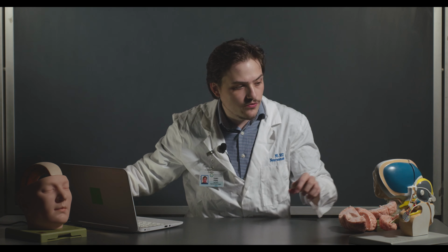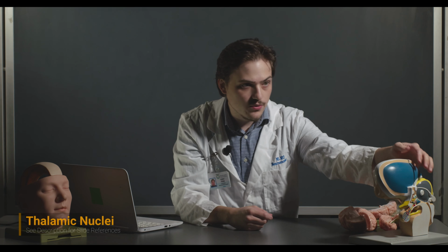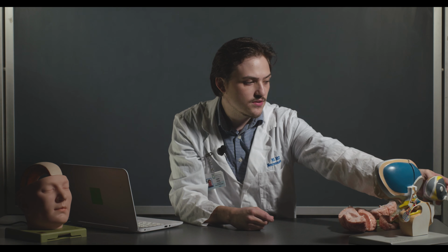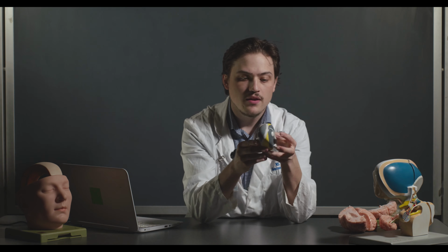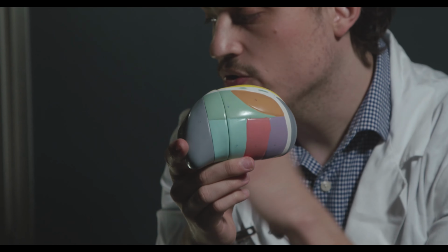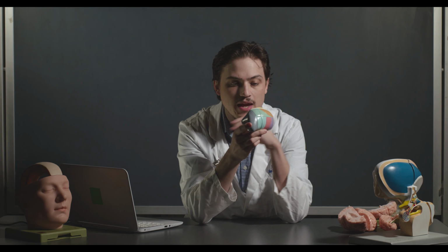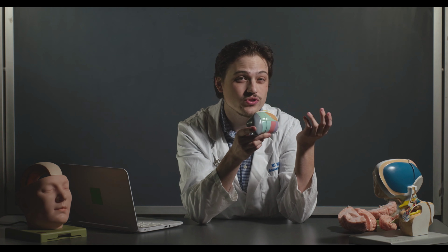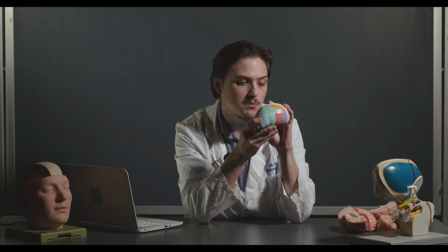And now we are going to focus on the thalamus. So this model over here is essentially the basal ganglia along with the thalamus and the hypothalamus. We're going to just focus on the thalamus, so I'm going to remove it here. So this structure essentially is also shown in your lab manual. And there's a bunch of different nuclei of the thalamus that you're going to talk about in lecture. And in lecture, you need to know the functions. For lab purposes, you just need to be able to identify them on this model.